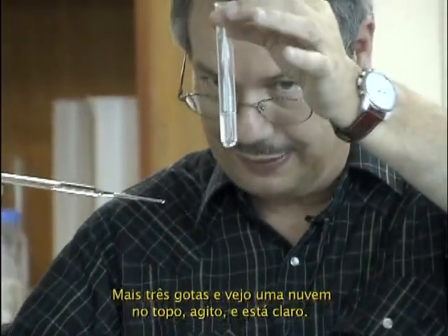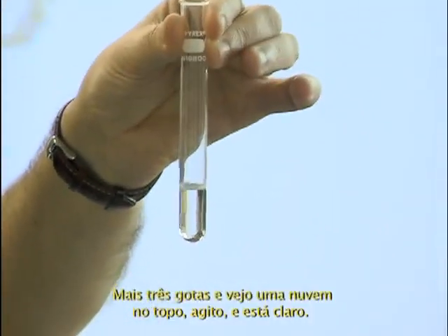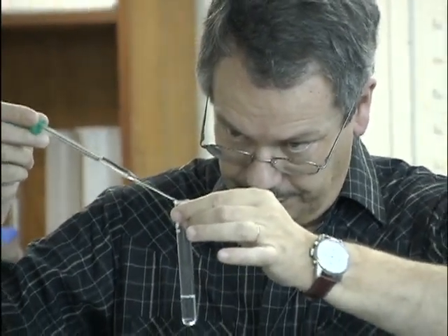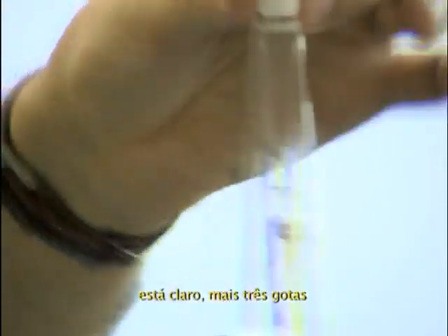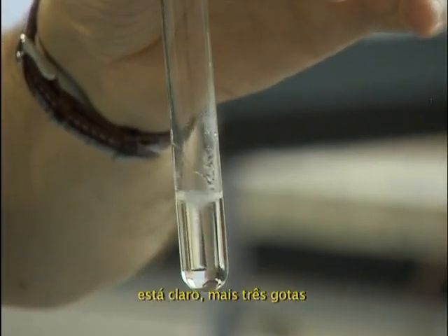I see a cloud at the top. I shake. It's clear. 3 more drops. It's clear. 3 more drops.